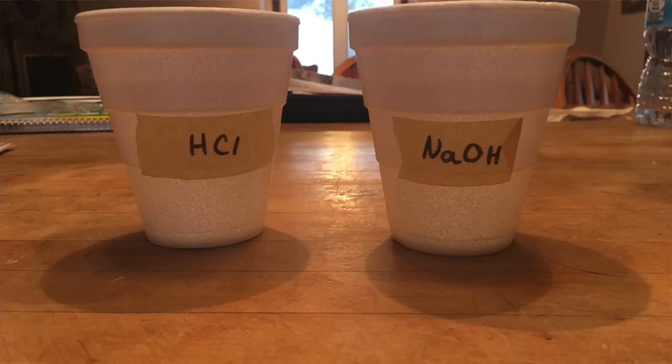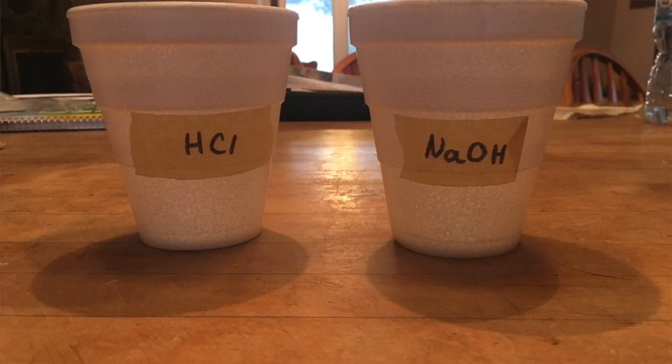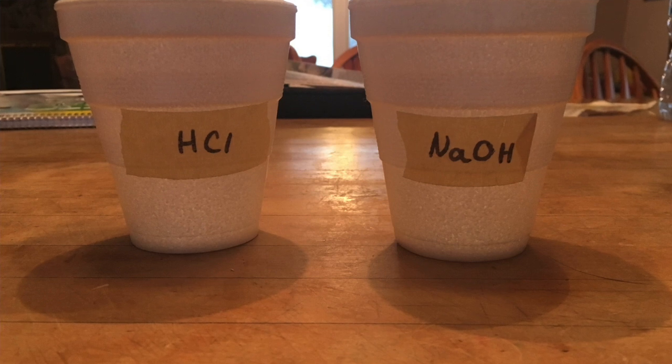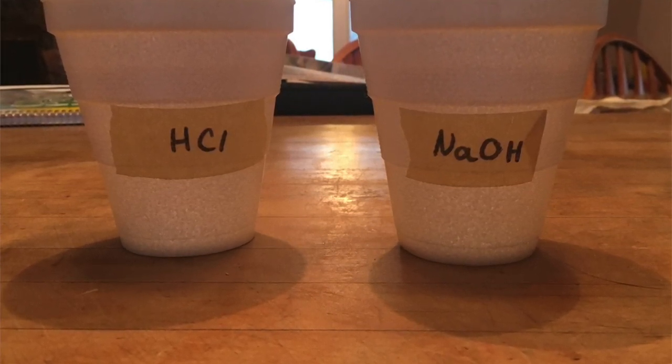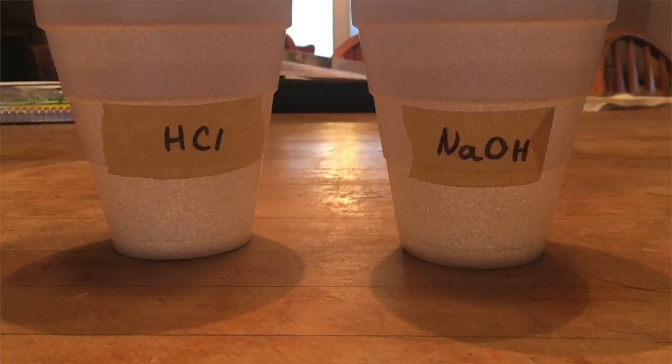The measurement of heat involved in this experiment was possible by using a process known as calorimetry, in which heat transfer is observed. A calorimeter is a piece of equipment with which heat can be measured. It measures calories, which are units of heat energy, reflecting the sample's temperature change.